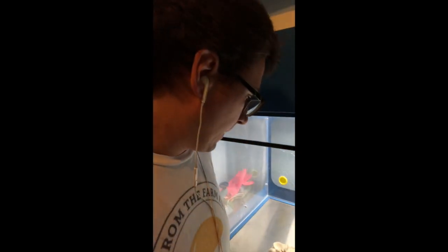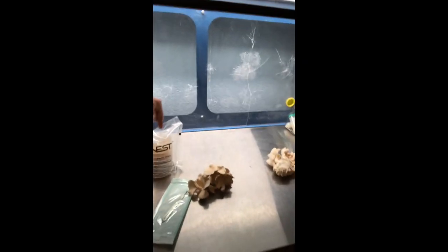It's got a really nice shape. All you need to do this is some MEA agar, and then I've got a clean sterile plate. I'll show you how I go about doing that.